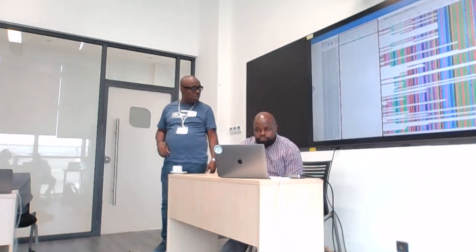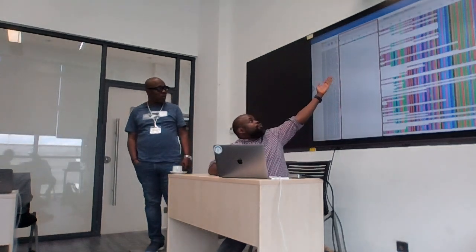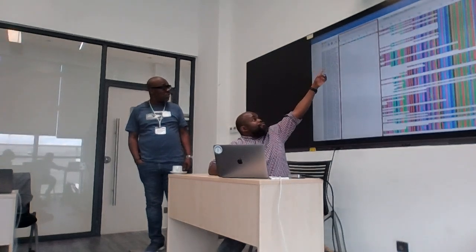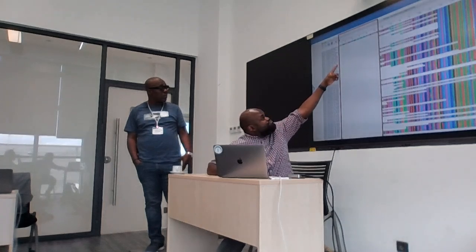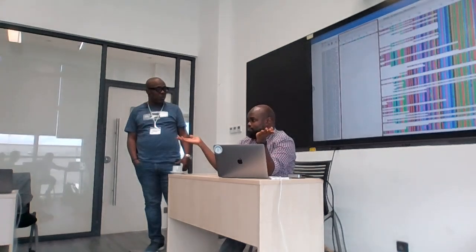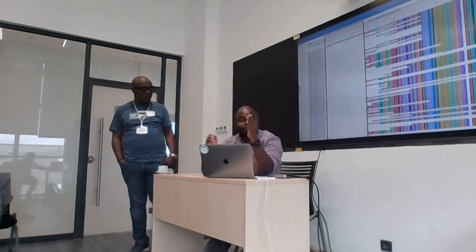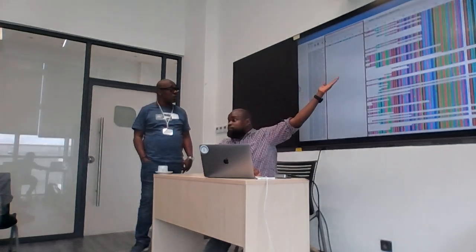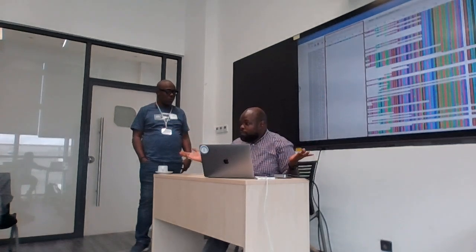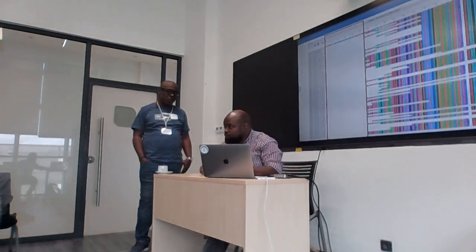Okay, good. There are also instances when you might want to keep it. Because, for example, in this case, we only have one sequence that has the position starting from there up to position 50, 55, right? But maybe it is the reference sequence, and you want to always know which is position 1 and which is position, you know. If you trim it, you're going to start from a different position. So you may want to leave it because it's a short distance. It's not going to affect it. But it's a different thing if maybe you're working with a gene, where there are different dynamics. So again, context is important.